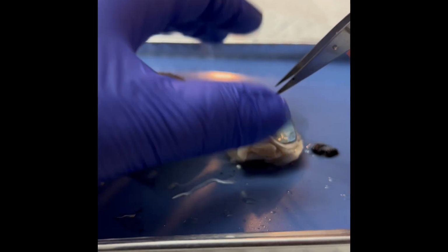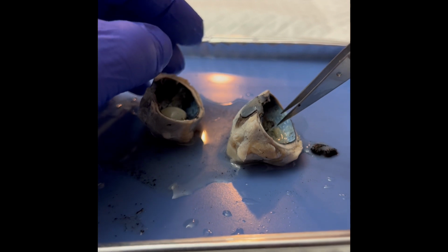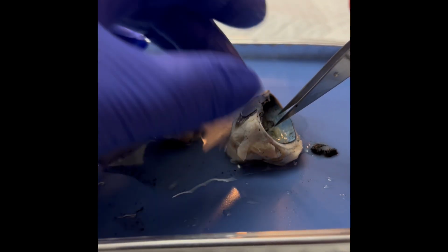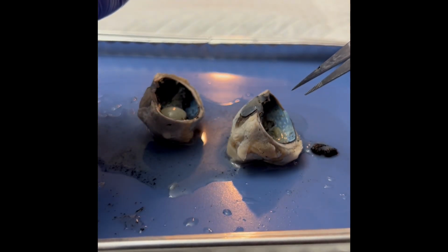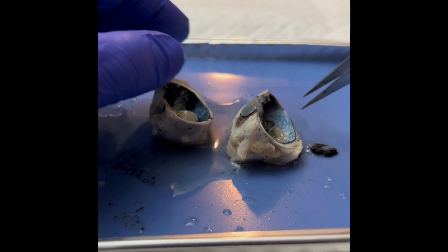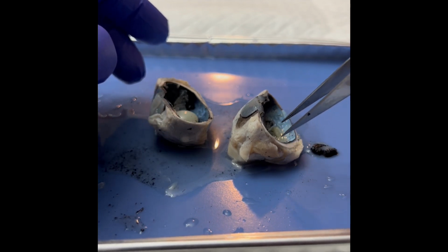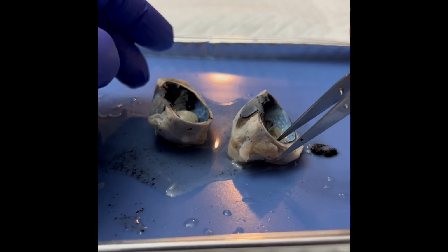And then the cranial nerves required for the pupillary light reflex are going to be cranial nerve 2, the optic nerve, and cranial nerve 3, the oculomotor nerve. And so that concludes that. I'll finish up the lab with the demonstration of the pupillary light reflex, and hope everyone has a good night.